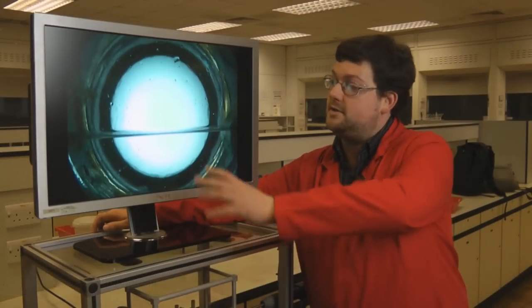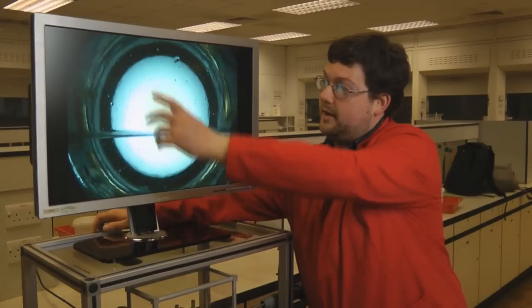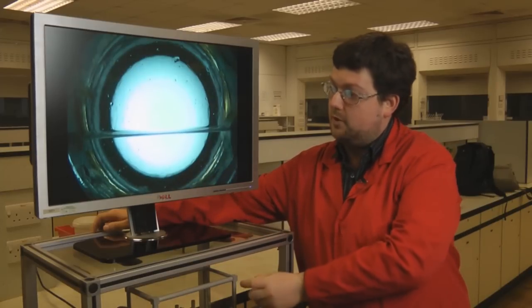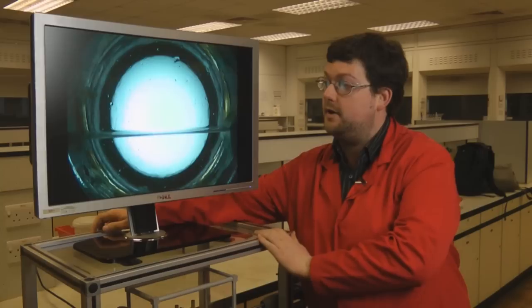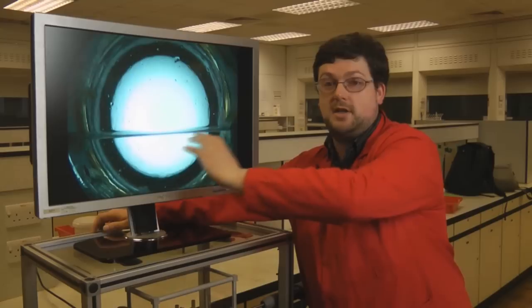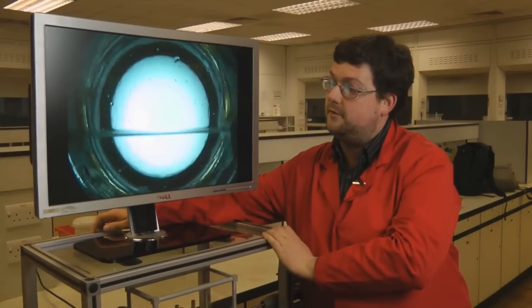This is our supercritical fluid demonstration. What we can see on screen here is a sealed cell with a camera pointing to the front of the window. If I shake the table, we can see the liquid inside vibrating.